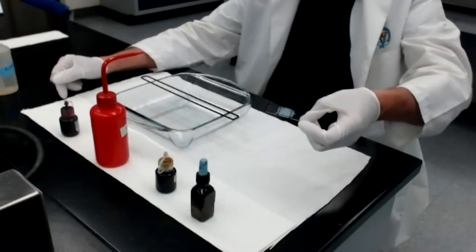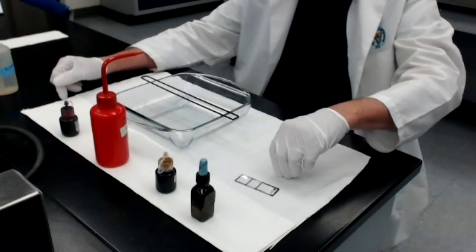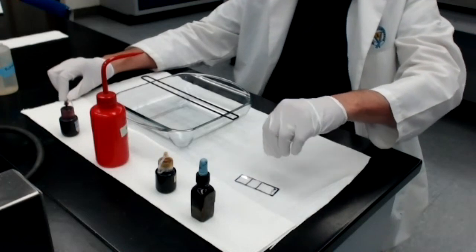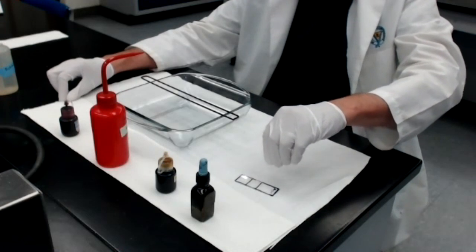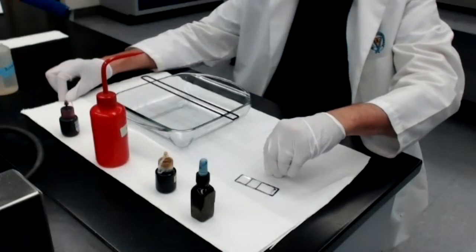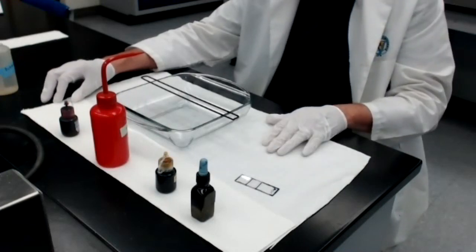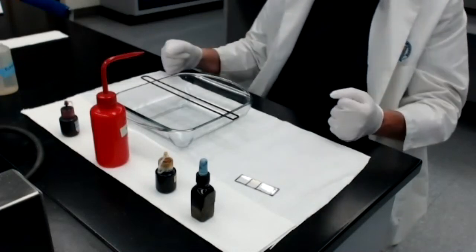This is a smear to which I added two different kinds of bacteria. The one bacterium is E. coli, which is a gram-negative bacterium. It should be pink at the end of this procedure. And the other bacterium I mixed in with the smear is Staphylococcus aureus. Staphylococcus aureus is a gram-positive bacterium, and so it should be purple at the end of the protocol. So if I do the protocol correctly, when I examine this stained smear under the microscope, I should see mixed together purple bacteria and pink bacteria.